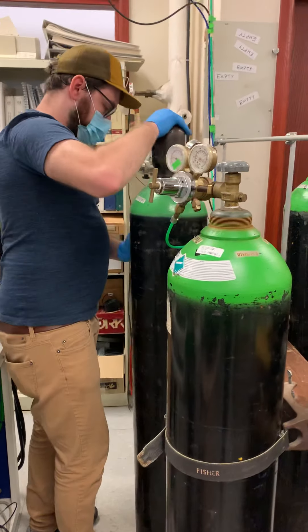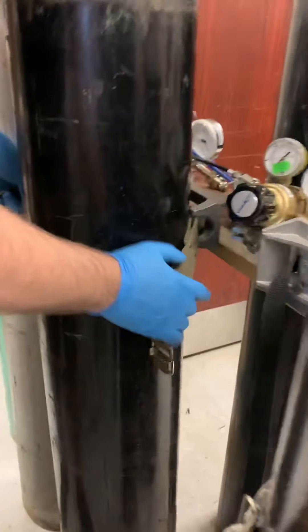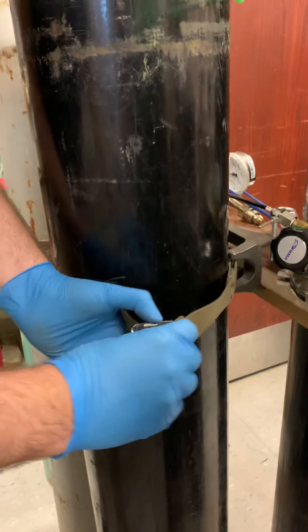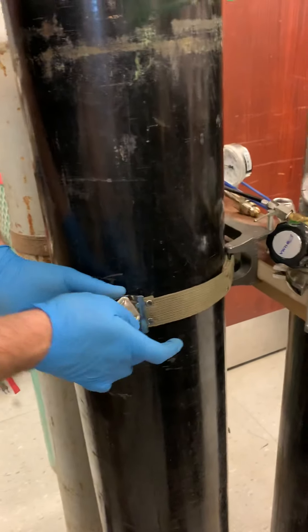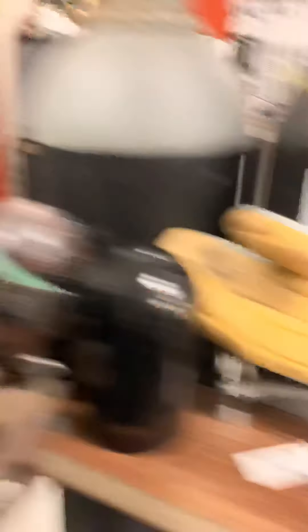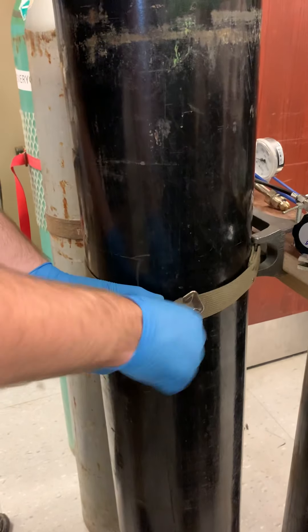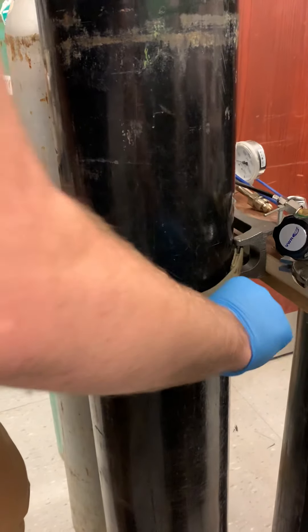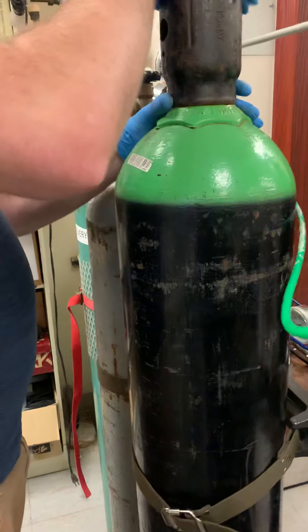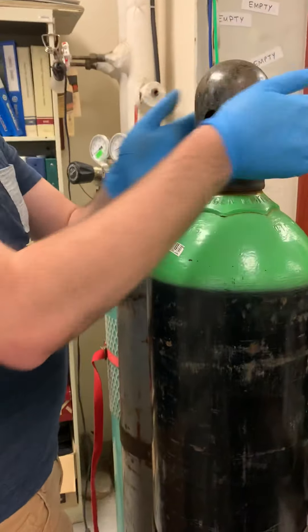We have to tie the cylinder into position. Here we have made this frame — Sander has made this frame — which is really solid. I cannot move it. I have seen cylinders attached to things that are movable; it's completely different. Now take the cap off. This is sometimes tricky, so that's why we have a really big spanner to whack it with.